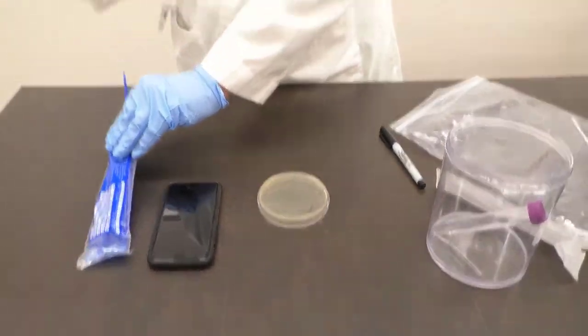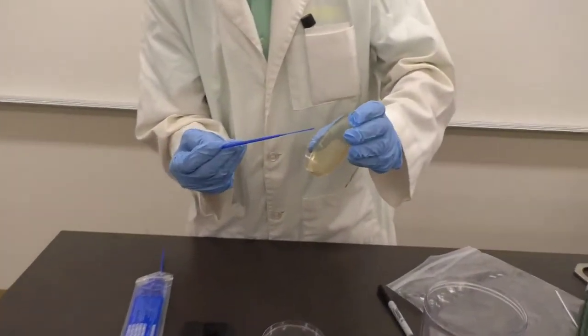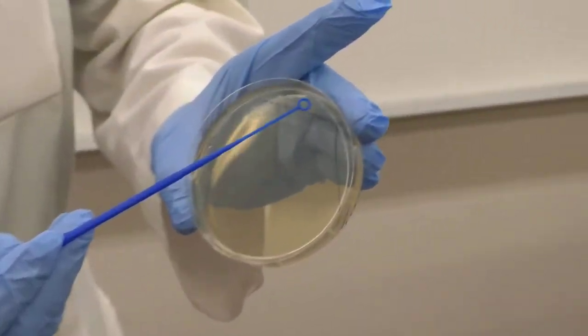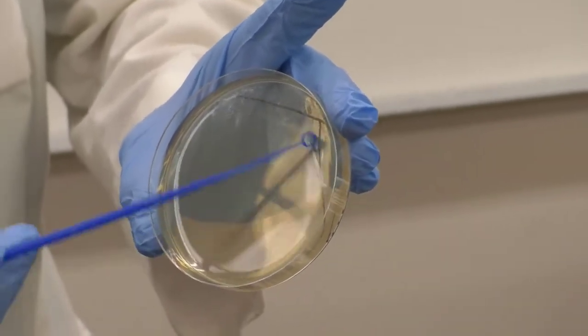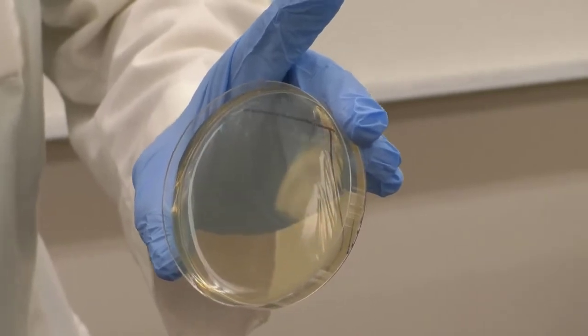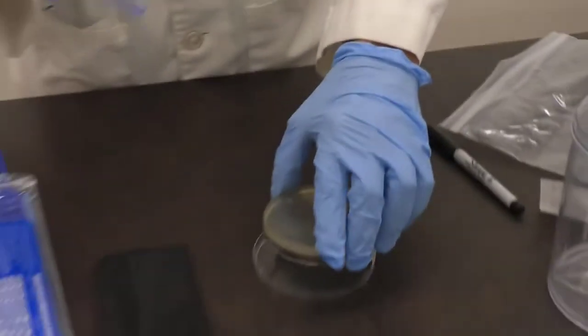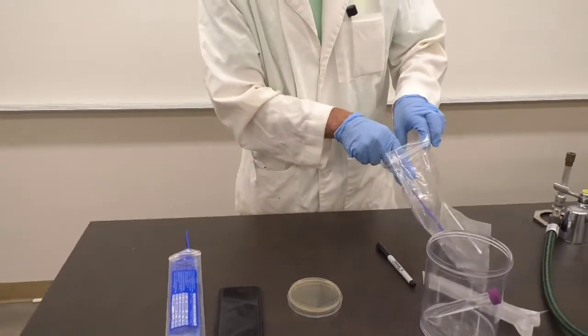Okay, a disposable sterile inoculating loop. I'm going to go into the original streak once and that represents my second streak. This also then goes in the biohazard.